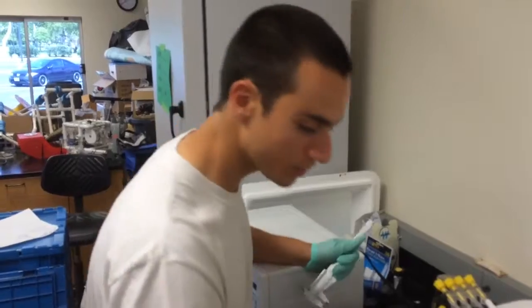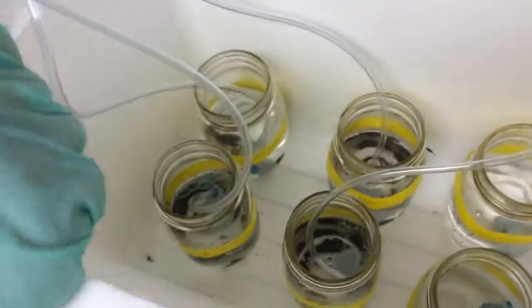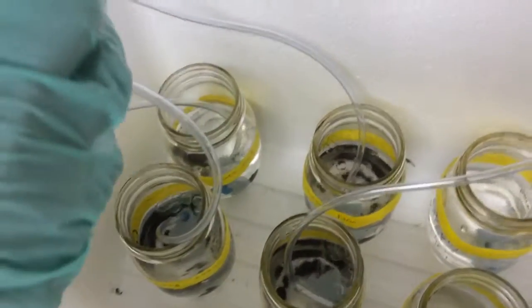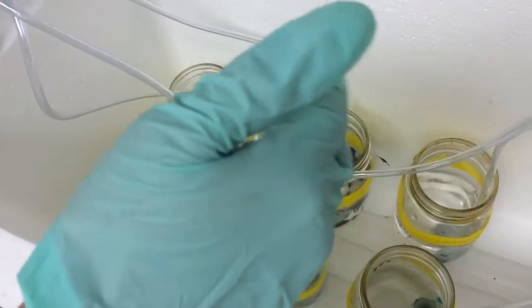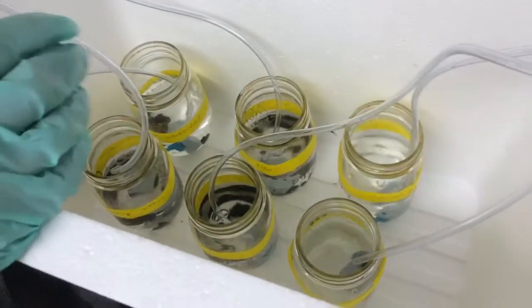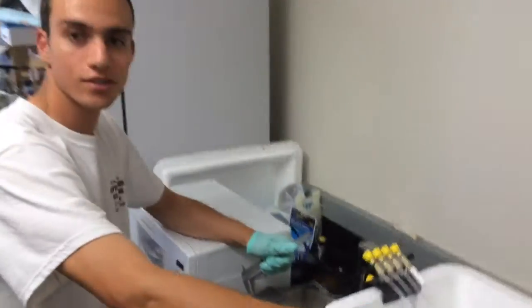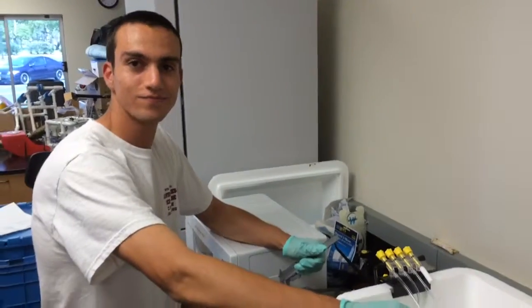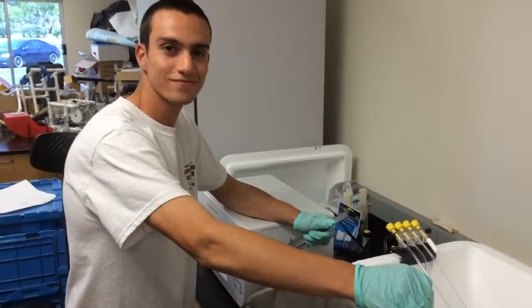And now we have two different types of oils — a weathered one and a newer one. And we're going to put these crabs in and kind of test it out. Do a short-term acute mortality experiment?